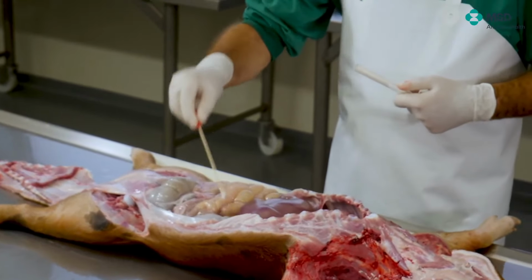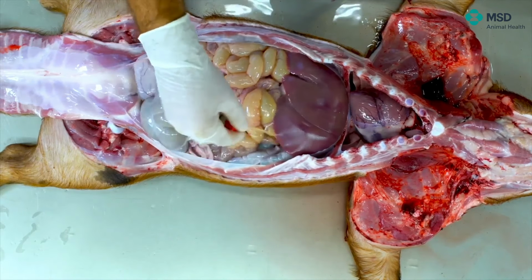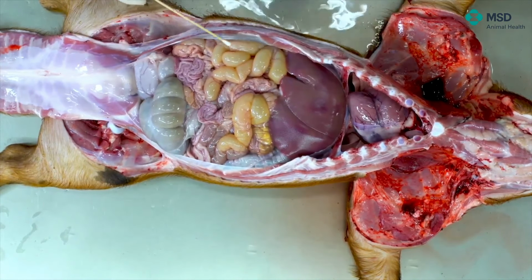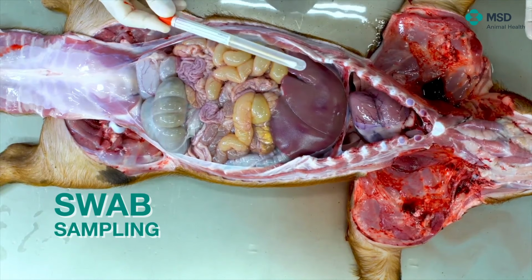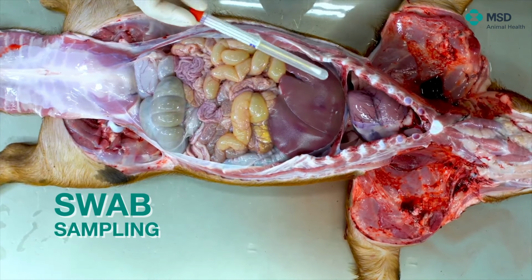of course, as you can see, we have not touched at all the thoracic or abdominal cavity. Of course, with a different swab, we will do exactly the same for the thoracic cavity, but then the sample is there and it's ready to be submitted to the microbiological department. Of course, we will have to note and annotate all the data from the animal.